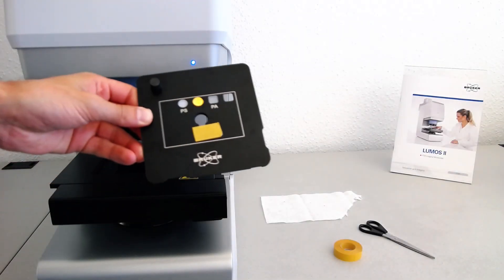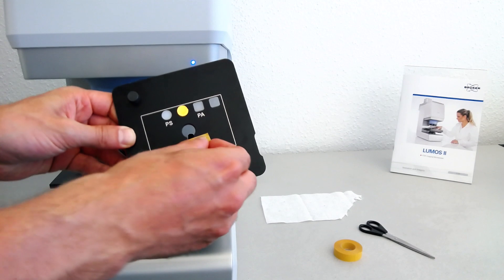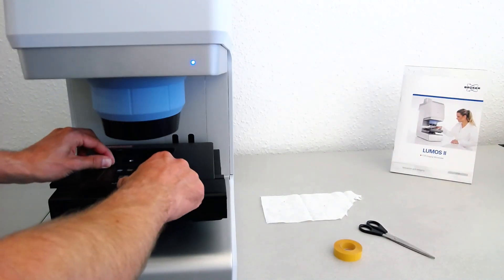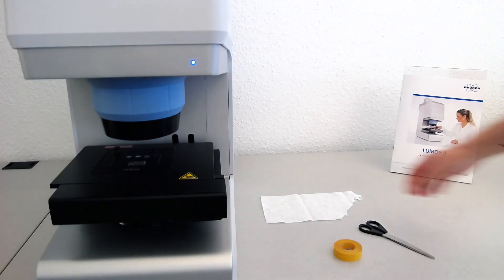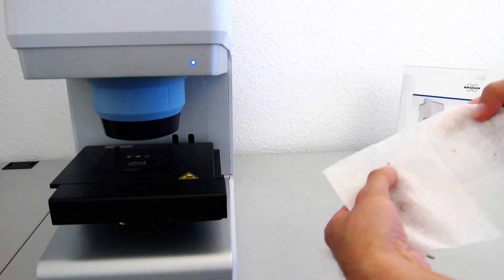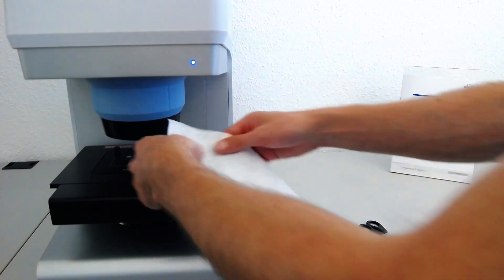Before we start the analysis, we'll put some double-sided tape on the sample stage to make sure the fleece doesn't move while we're making measurements. We'll make sure a contaminated area of the fleece is under the microscope, and then we can take a look at the sample.